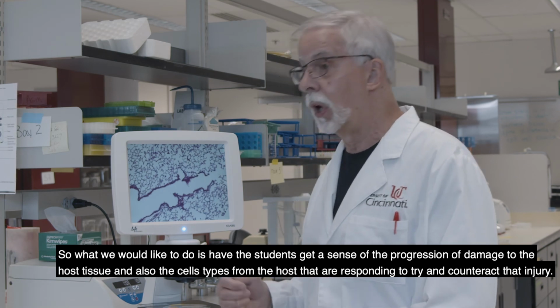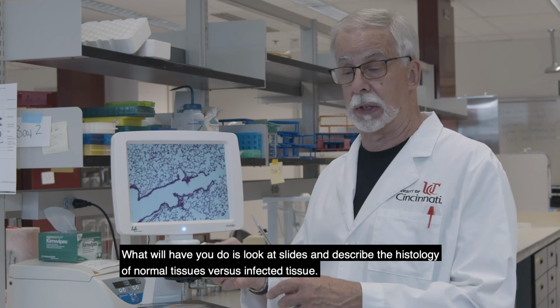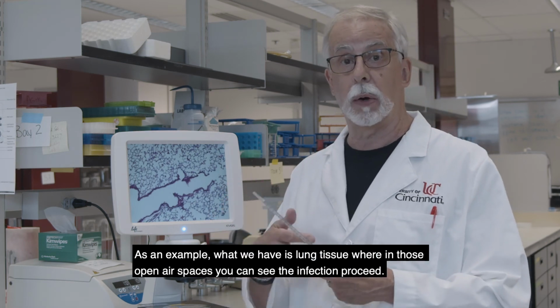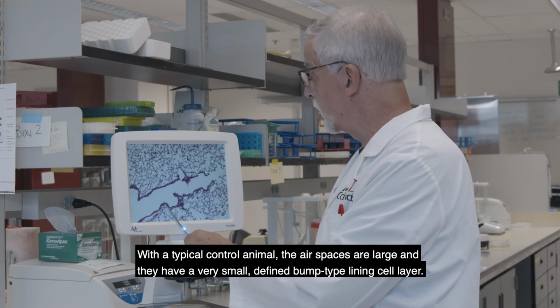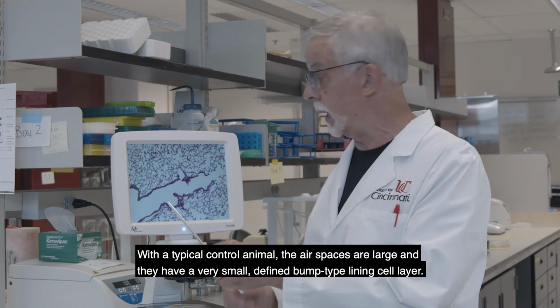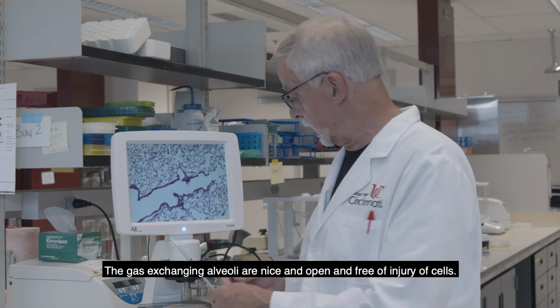that injury. So what we will have you do is look at slides and describe the histology of normal tissue versus infected tissue. As an example, what we have is lung tissue where in those open air spaces you can see the infection proceeding. So in a typical control animal, the air spaces are large, they have a very small defined bumpy lining cell layer, and the gas exchanging alveoli are nice and open and free of injurious cells.